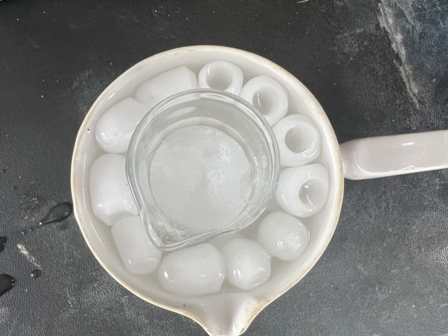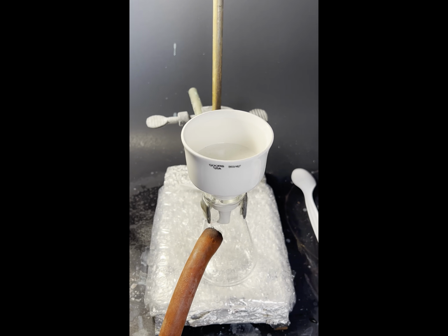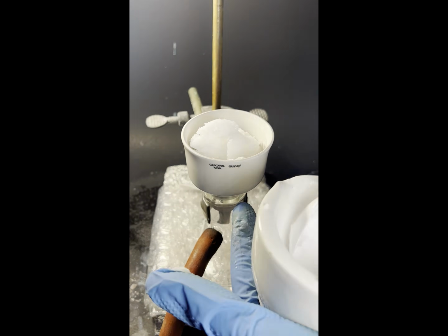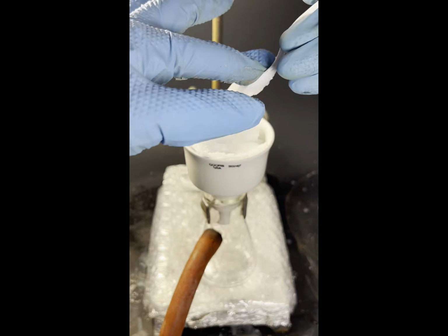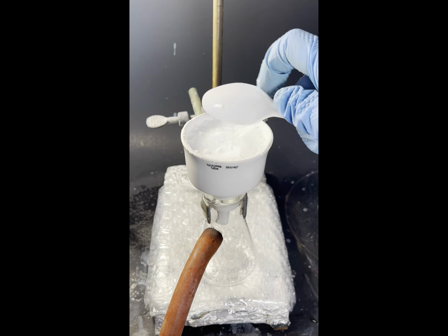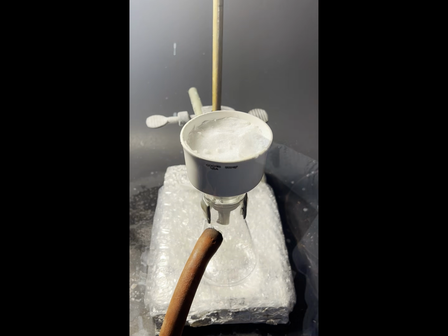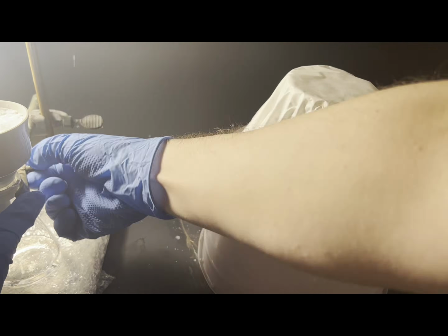It's liquid because it's supercooled, until I just picked the beaker up and it immediately began to spontaneously crystallize, which I wish I got on camera, but it happened too quickly. Once I felt it had cooled enough, I hurriedly crushed the chunks in a mortar and pestle and began to filter the mixture. This is the same fractional freezing technique I used to purify the PDCB in a previous video. The liquid I don't want, the solid I do.